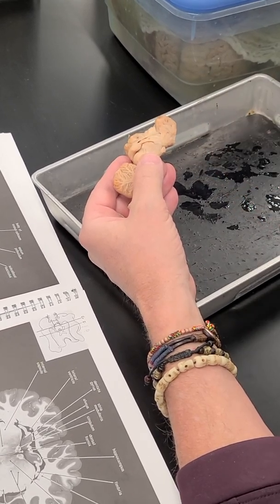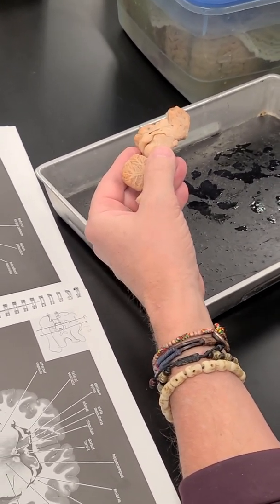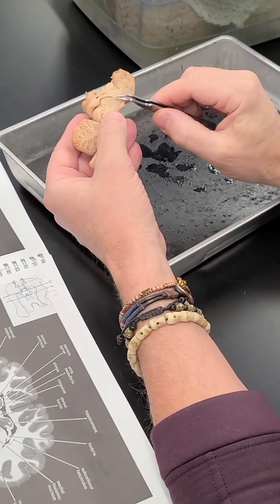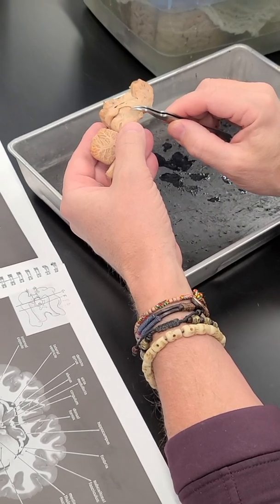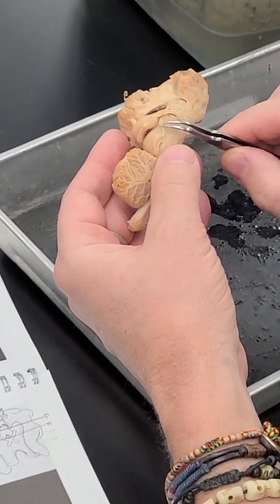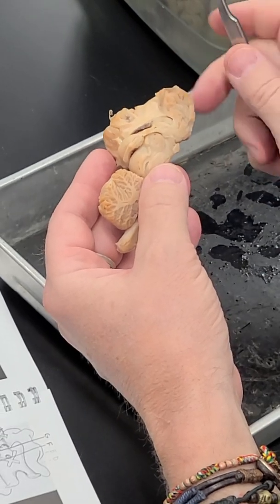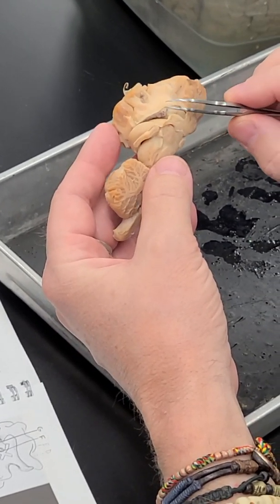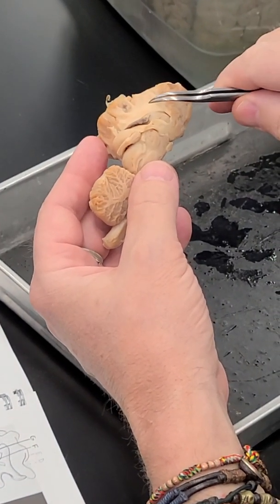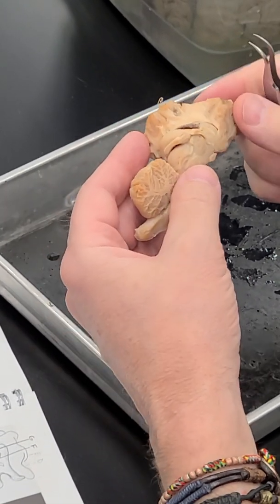And commissure just means bundle? Commissure means it goes across from left to right. Oh, yes, okay. And so commissural fibers are fibers that decussate or cross from left to right. Mm-hmm. So we have the anterior commissure just rostral to the thalamus, and you can't really see it here, but there's a bundle of fibers right here, the posterior commissure, that's just caudal to the thalamus. And then we have the corpus callosum, which I've torn away up here, but you can see in your sagittal sections, which are a lot of the fibers from the internal capsule that are going from left to right.